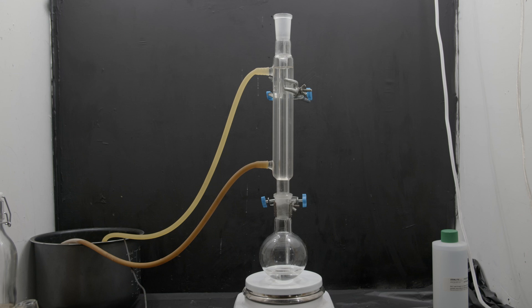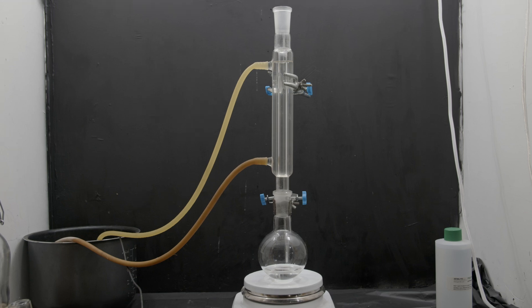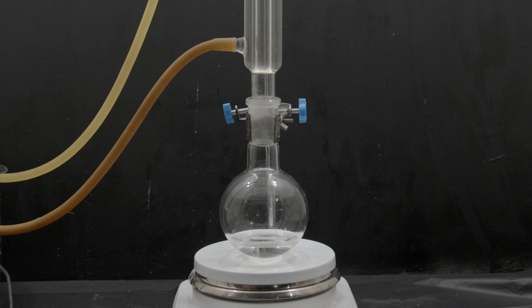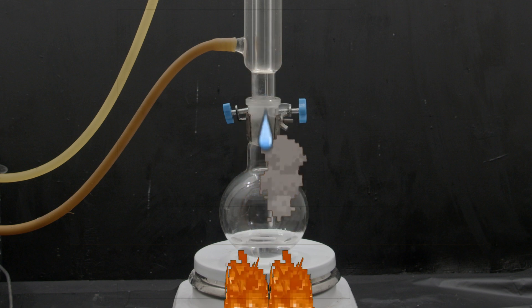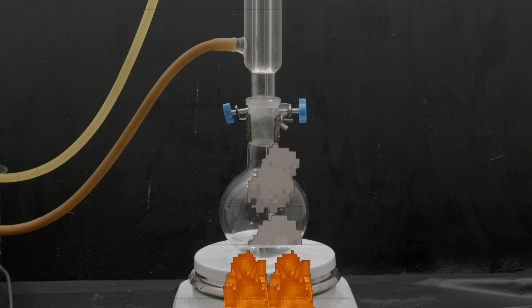And after that we set up for reflux. Now to those who don't know what reflux is, this is basically a way that we can heat up the liquid without it boiling off, because once it boils it gets collected as a liquid and then it drops back down into the flask. I leave it like this for a little over an hour.